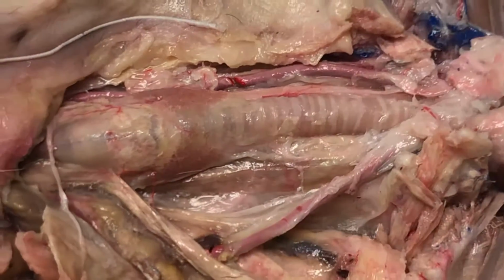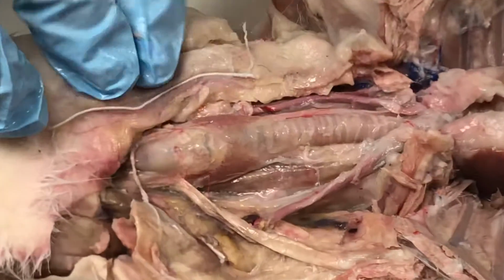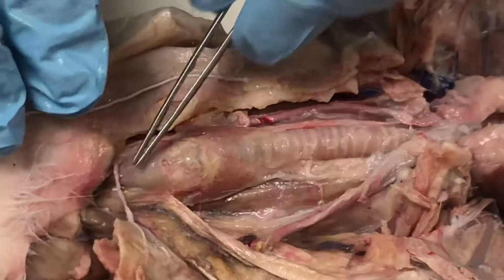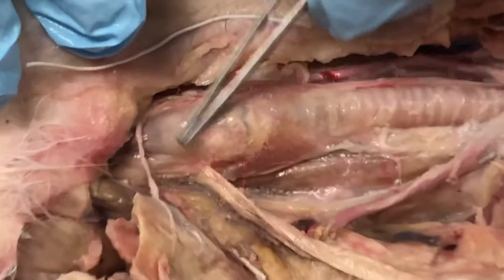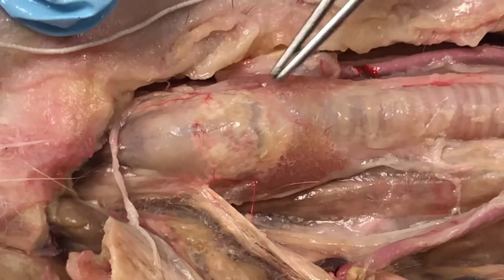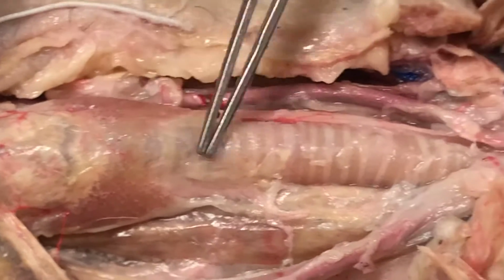Okay, so the respiratory structures for you guys to identify. Let's begin from superior and move inferiorly. Up at the top here, we have the larynx. That's the voice box, of course. And you can really feel that thyroid cartilage right there of the larynx. As we move inferiorly, this is actually the thyroid gland, not a respiratory structure, an endocrine structure, but still, that's where it is. And then we get into the trachea.